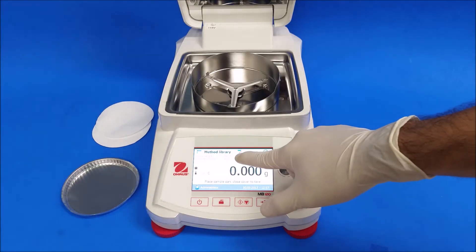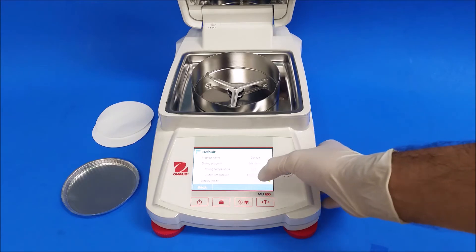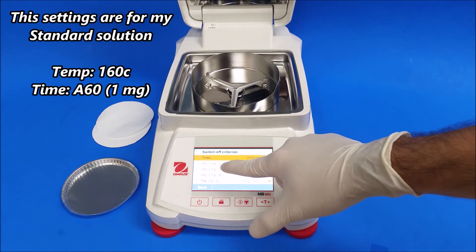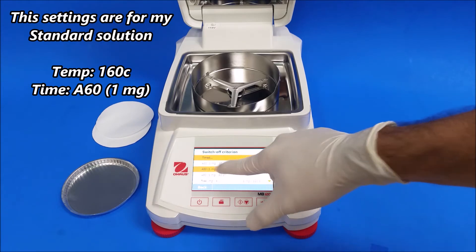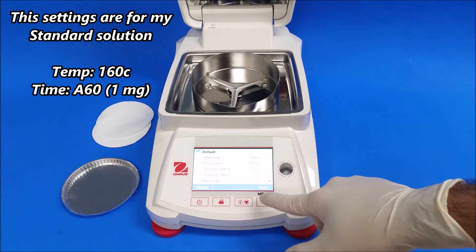I'm going to change a setting here really quick. Because it's running, it's going to stop at 10 minutes. I don't want it to be running at 10 minutes because I'm going to be running a standard solution. I just want it to stop by itself.